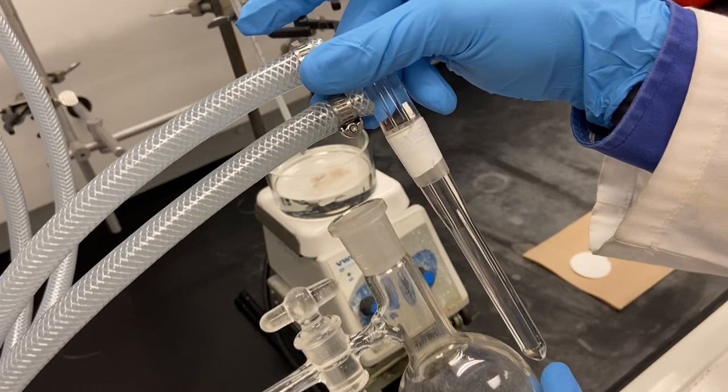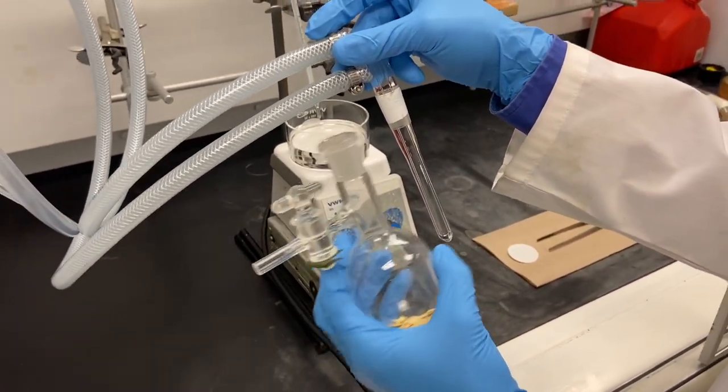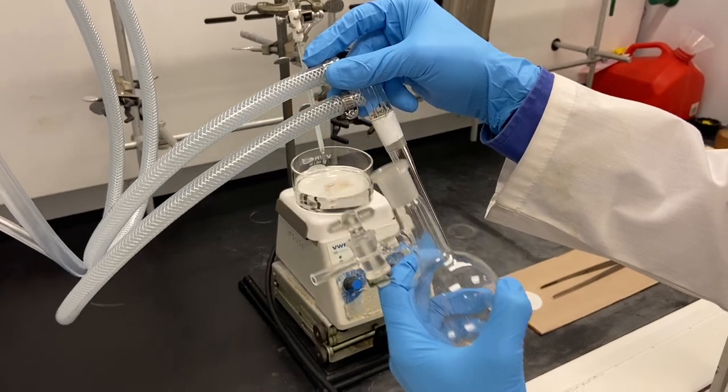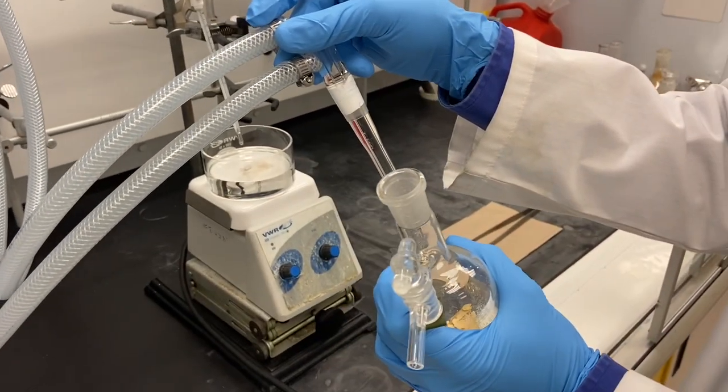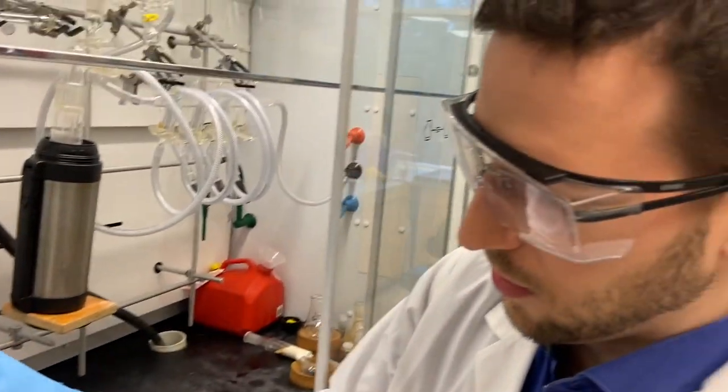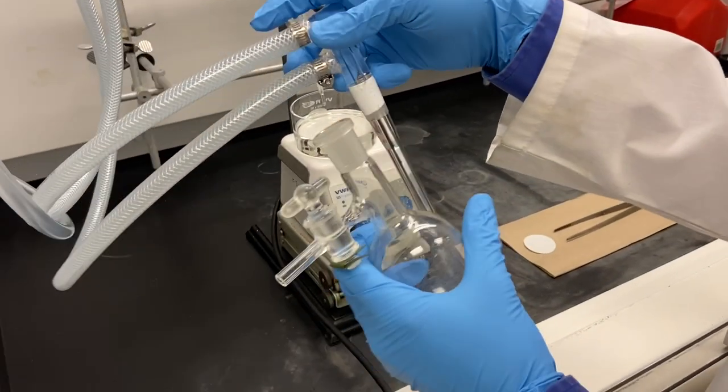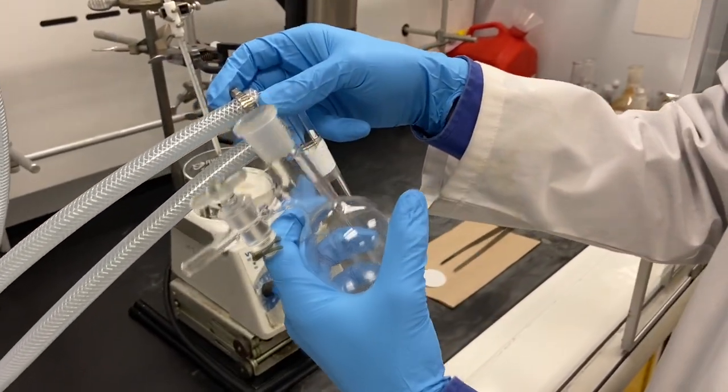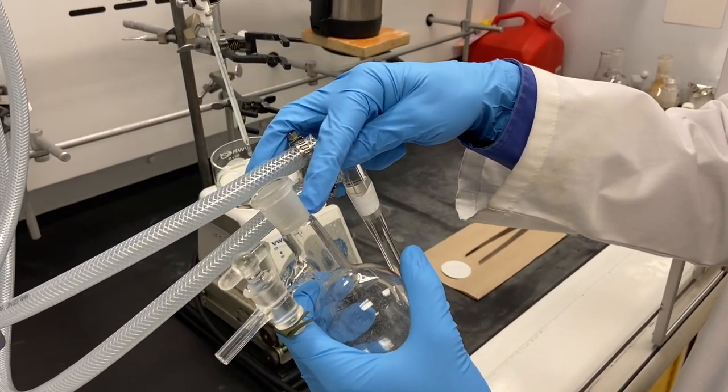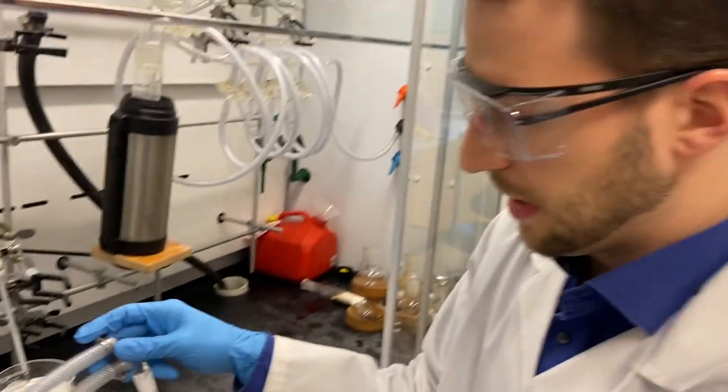This is not the perfect setup. If you choose a sublimation setup for yourself, you should check that the cool finger is significantly slimmer than the connector here, because when you draw out the cool finger you don't want all the crystals to fall off in the socket. That is also the reason why I put some Teflon tape here, because if you have grease your crystals might stick to it later.